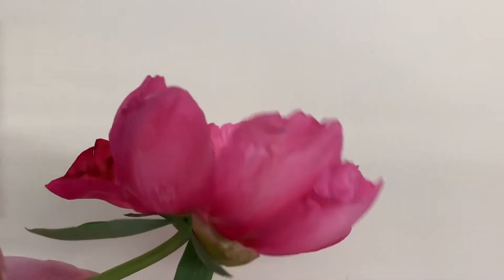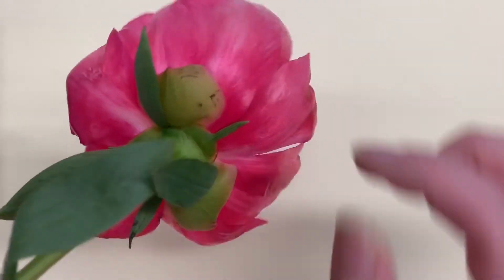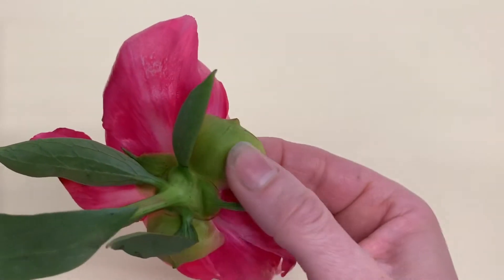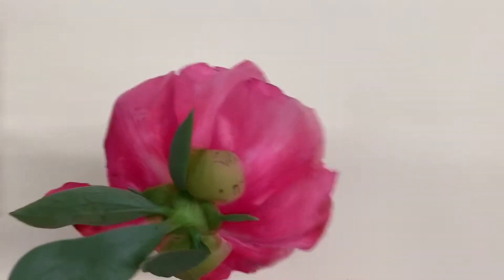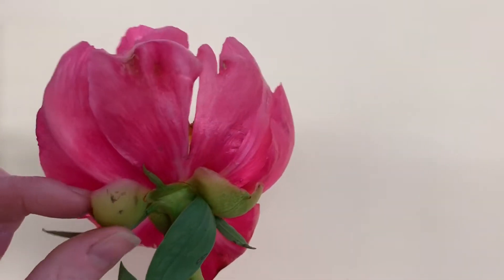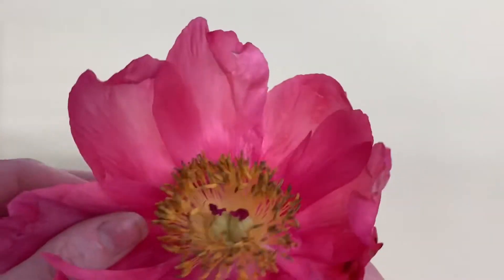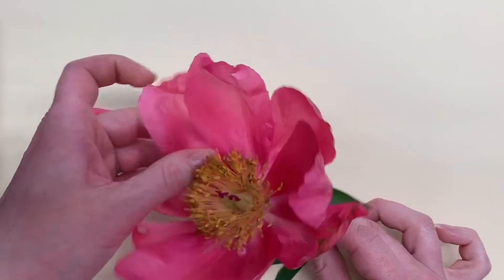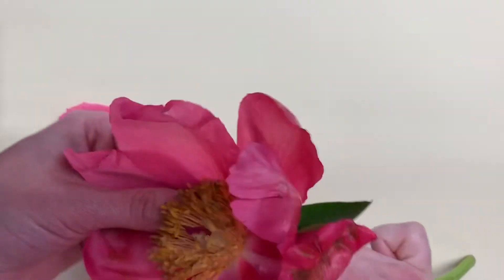First we're going to flip over the flower. If you look here you can see the sepals — these are the sepals which cover the reproductive structures until the flower is ready to bloom and the reproductive structures are mature. Here are the petals, so we're going to remove the petals so that we can get to the other reproductive structures.